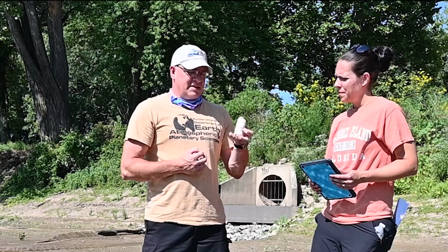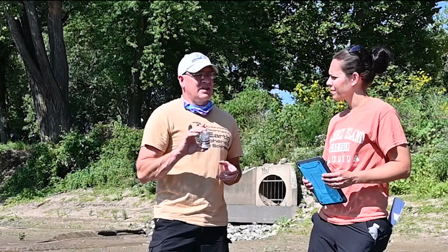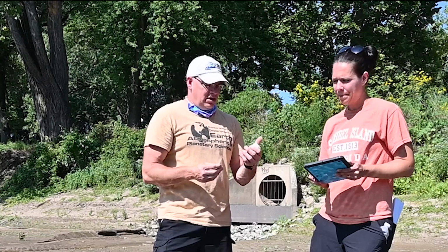And if this is what we have, and we're using these, then we want to test it with this next time. Let's say we're seeing what the pH is every day this week. We're doing a project, seeing if it's changing through the days. We would always want to use the same type of instrument. That way you know that you're getting consistent results. Because all instruments, whether it's a fancy digital one or something like a paper test, have a degree of error. So we want to make sure that we're being consistent in our experiments. And that's with anything we do.